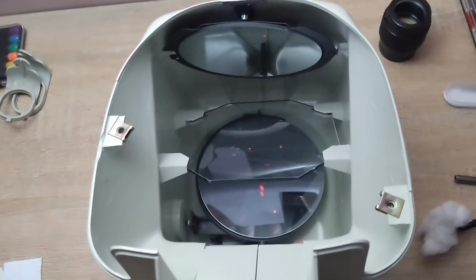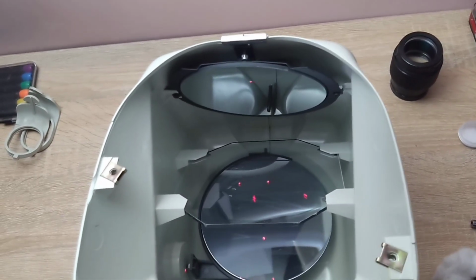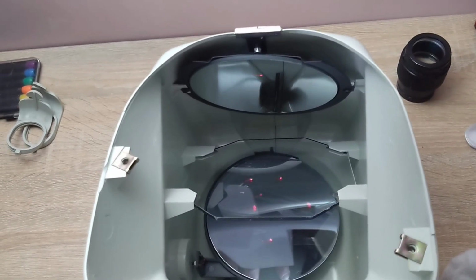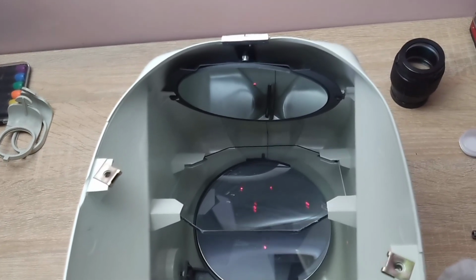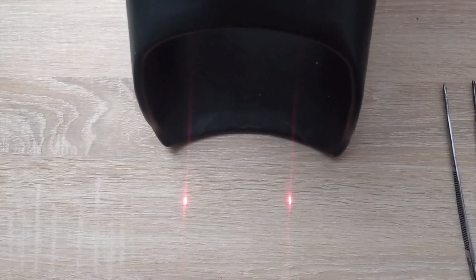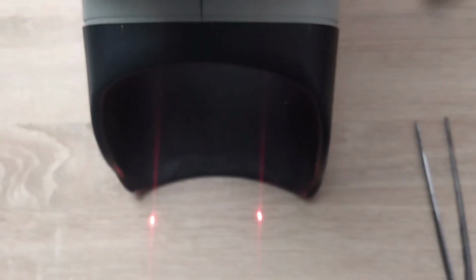I don't know how clear it is to you, but I'm showing with the laser pointer. In short, there are 3 points on the semi-transparent mirror, and on these simple mirrors, there is 1 point each, and in the final version, 2 beams come out. Do you see? I'm shining the pointer, and 2 beams come out.